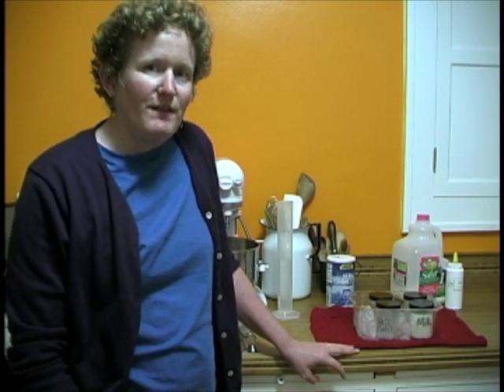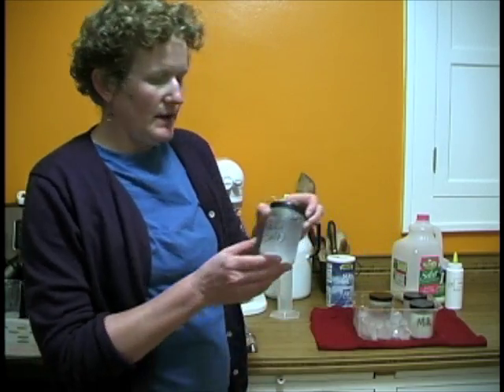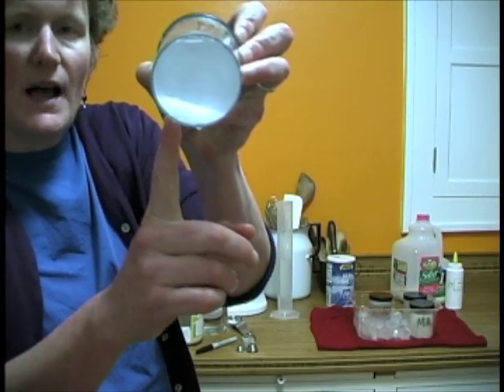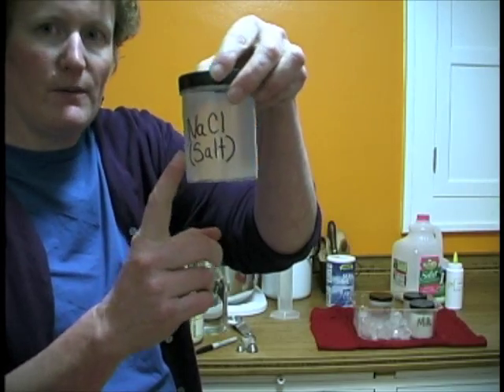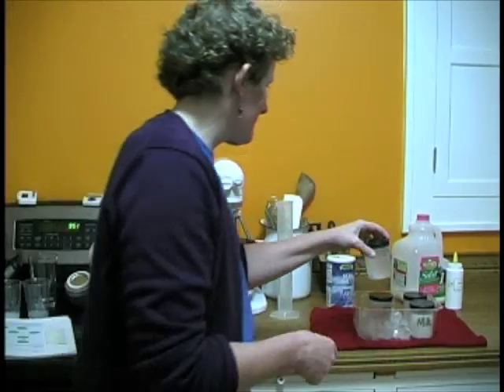In part C of the lab, we're going to check for the effect of temperature on solubility, and we're going to check and see if we have some solutions among all of our mixtures. I put all of the mixtures in a plastic box full of ice, and you can see that some of them have changed. The salt water, when it cooled down, now has some solid on the bottom. So the solubility of the sodium chloride, the table salt that we used, has changed when we changed the temperature. And that is a characteristic of a solution.